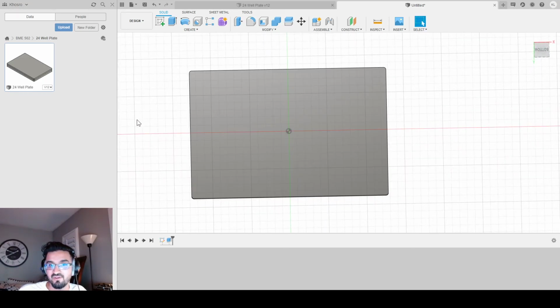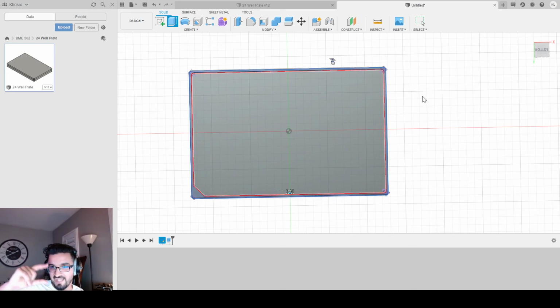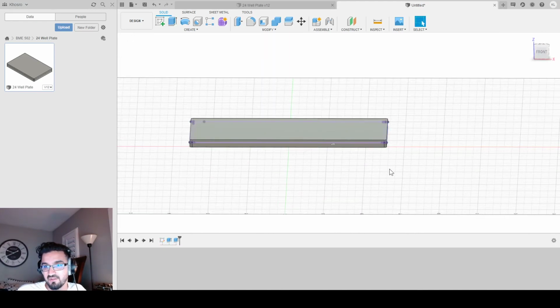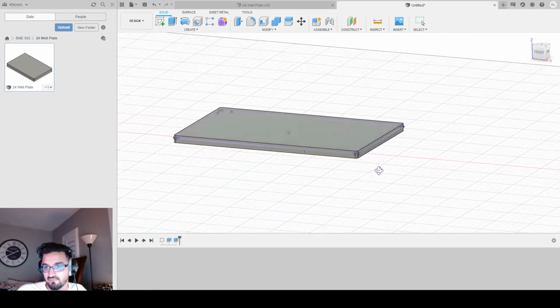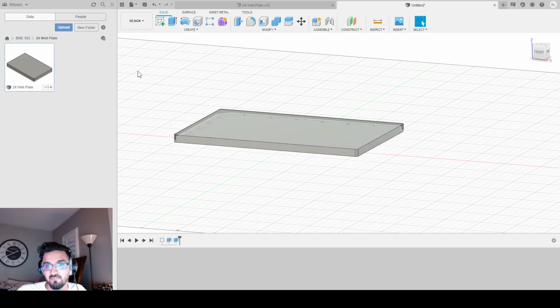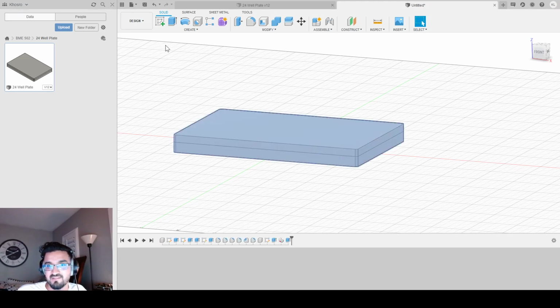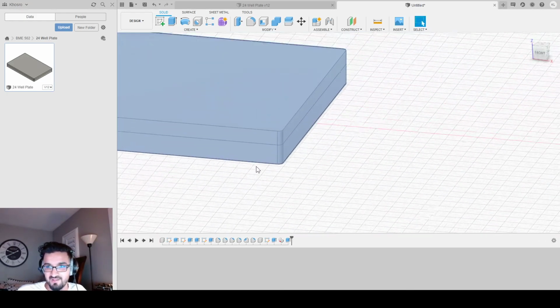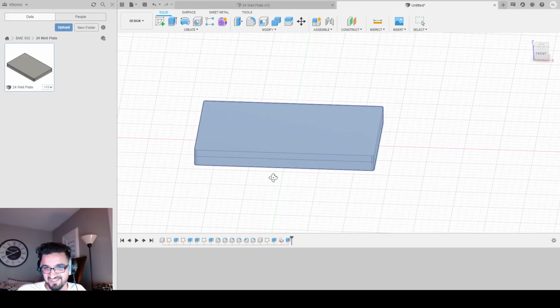If I scroll down and I turn on my sketch, I now can just select the bottom here and extrude this out by 3. Well, -3 kind of. Because I made that little gap 3, making this extrude towards me by 3 will essentially cover that gap, right? So now I have my lid and it's pretty much done. I could hide this sketch and bring back my plate and select the entire thing and you could see a perfectly sealed 24 well plate. Yay, you did it. It's a 24 well plate. So yeah, that's essentially how you make a 24 well plate.